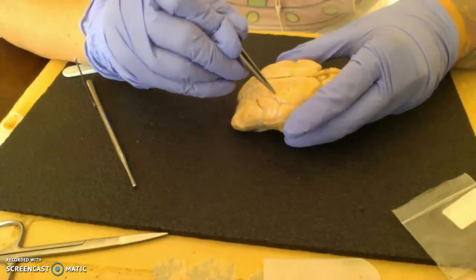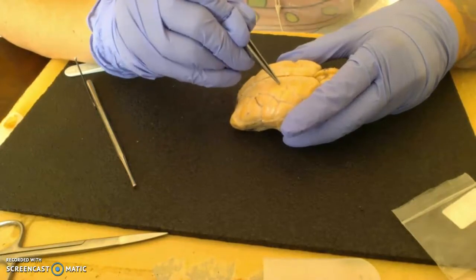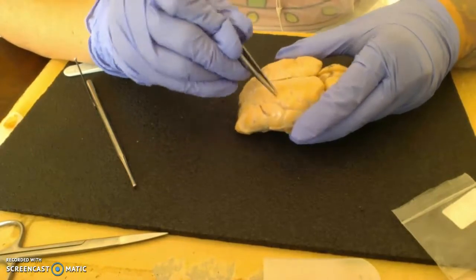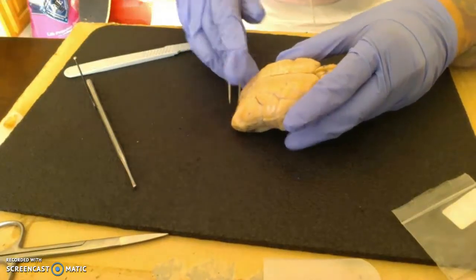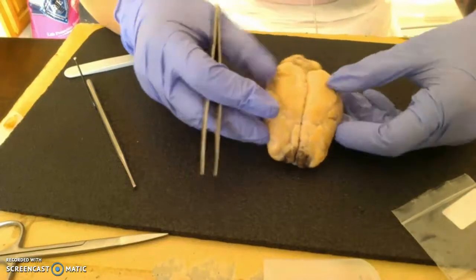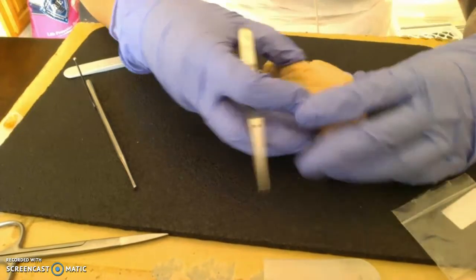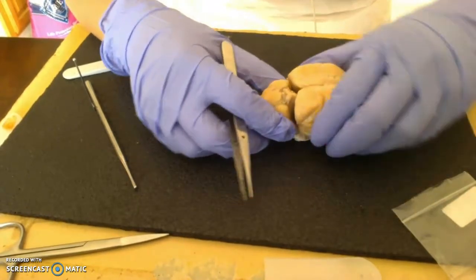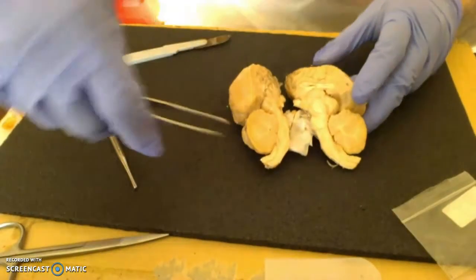And then the bubble aspect of it is the gyrus, or gyri plural. And so it's going to be these little meaty bubbly areas. Okay, and then let's go back. So then we have cerebral cortex, cerebrum. We have cerebellum. Then we can go into here.